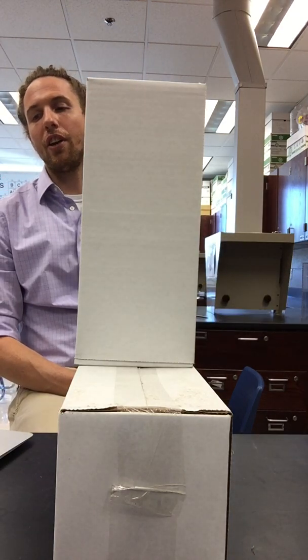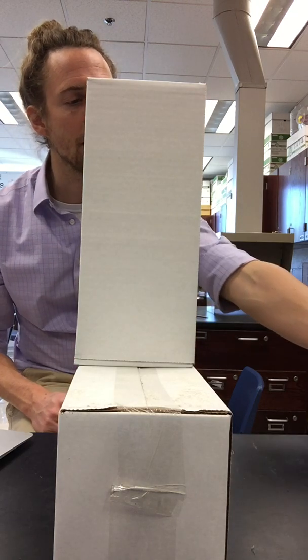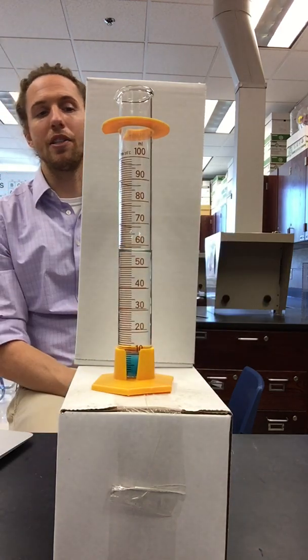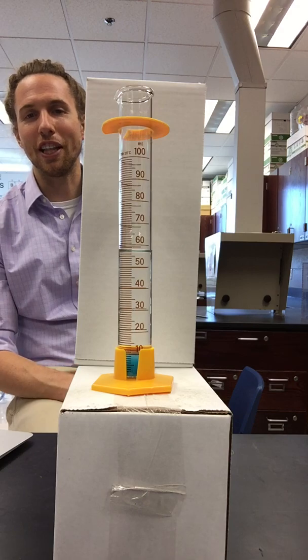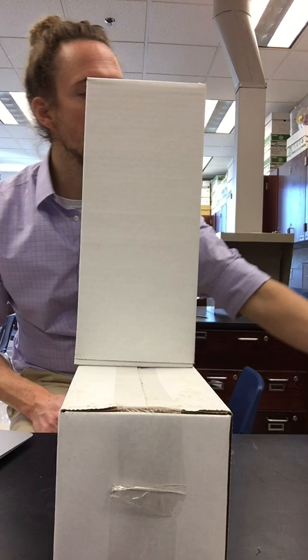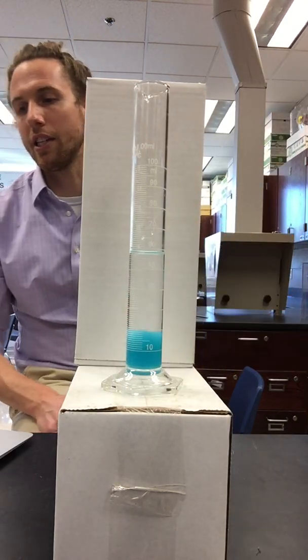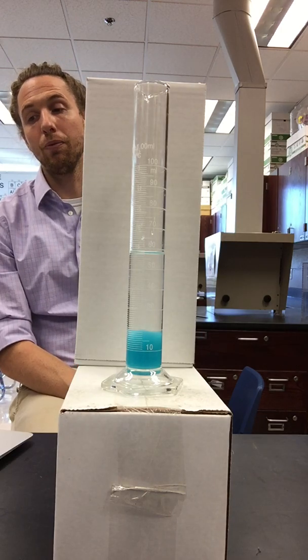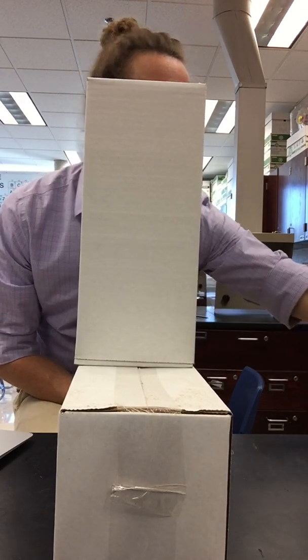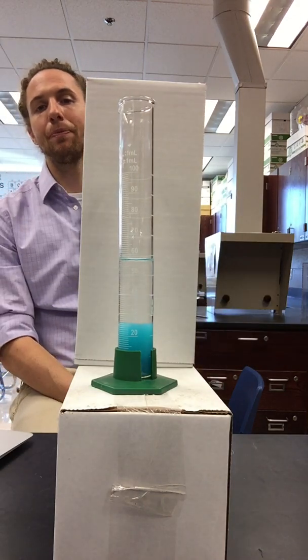Let's move on to the graduated cylinders that contain copper(II) chloride and sodium phosphate. So cylinder number 1, this is the 1 to 5 ratio. The precipitates here are going to be blue. Again, you can go ahead and pause if you need to get those volumes recorded correctly. Cylinder number 2, this is the 1 to 2 ratio. Here's cylinder number 3, 2 to 3 ratio.